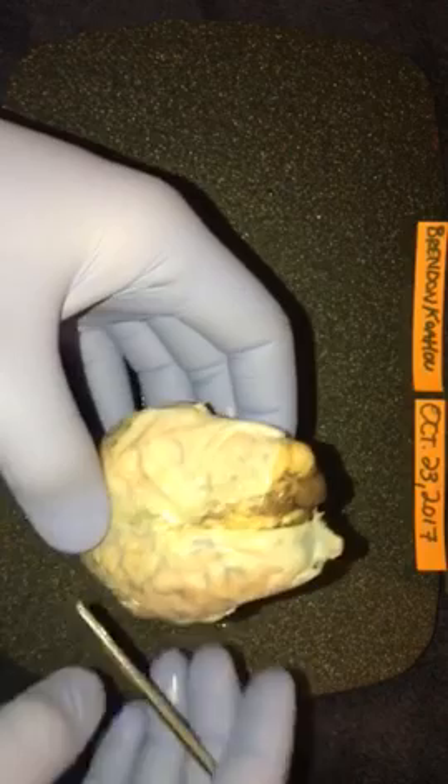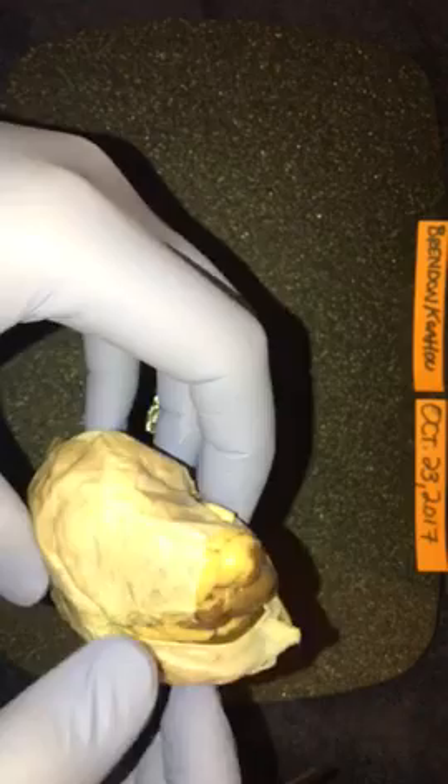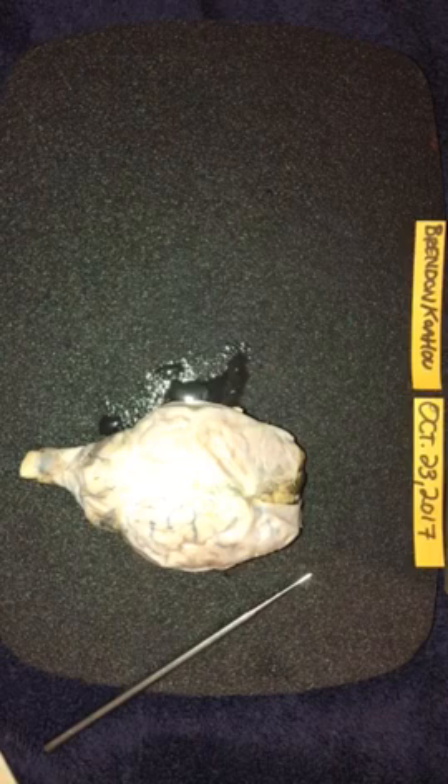The cerebellum, which is the back right here. We have the parietal lobe, which is right here. And then we have the mammillary body, which is right here. Flip it back over now — let's see what else we can take a look at. This is the frontal lobe. I'm actually gonna make my first incision here so we can get a better picture of exactly what it is we're looking at.